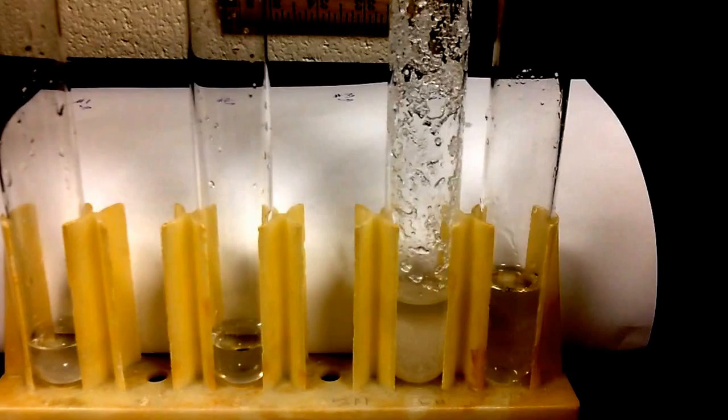Now, this is a very unstable situation, and so what we're going to do is test that theory. The theory I'm testing is that we made a supersaturated solution at this point.